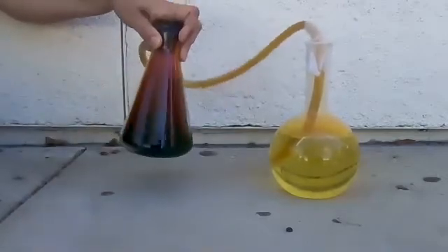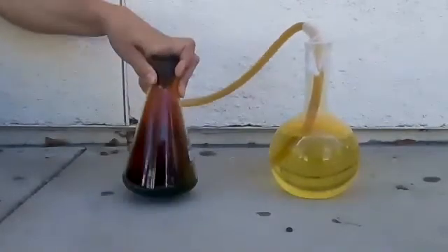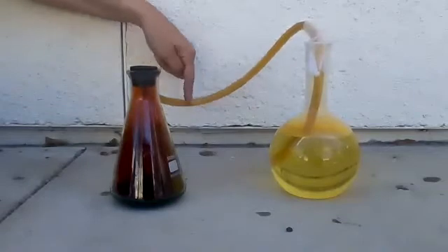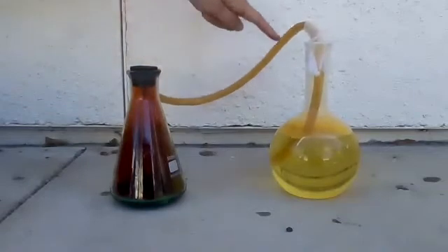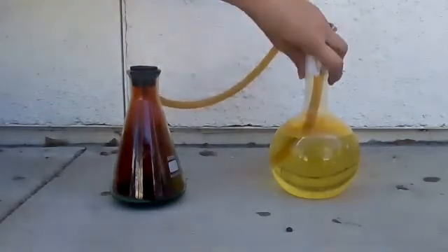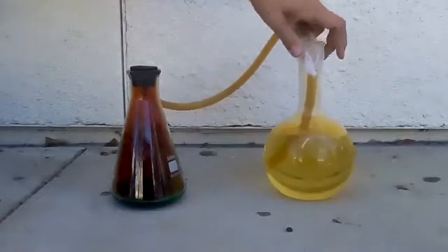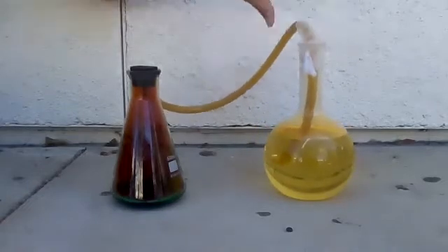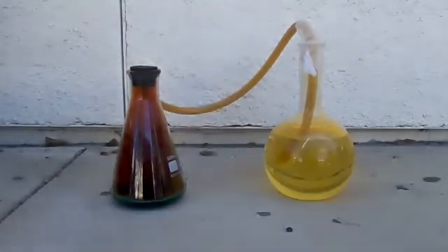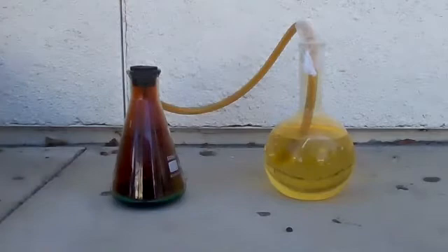So we've got the greens from the copper, the brown from the gas. You can actually see the gas in the tube as it's going around, then turning this yellow. Each bubble coming out is a brown bubble.